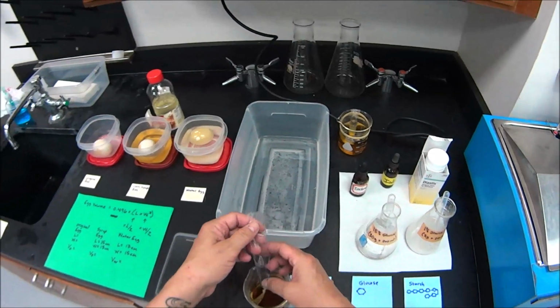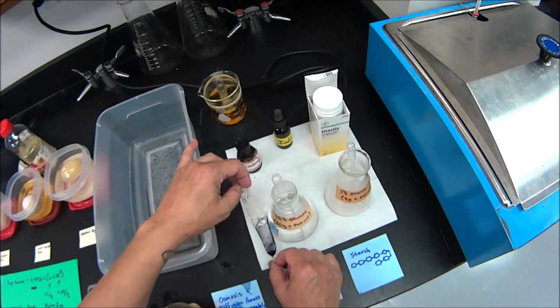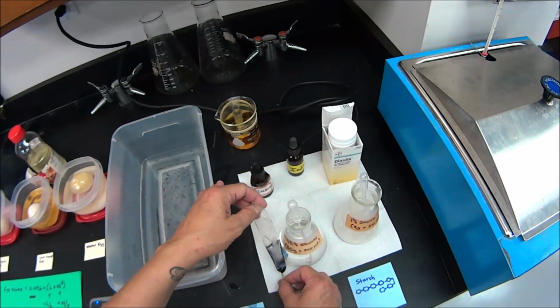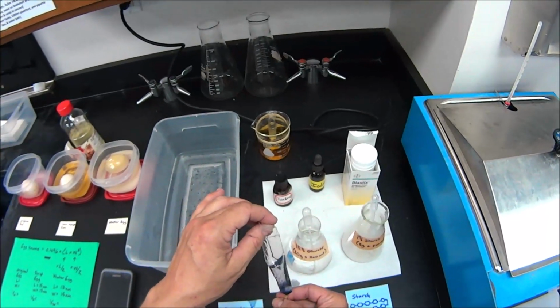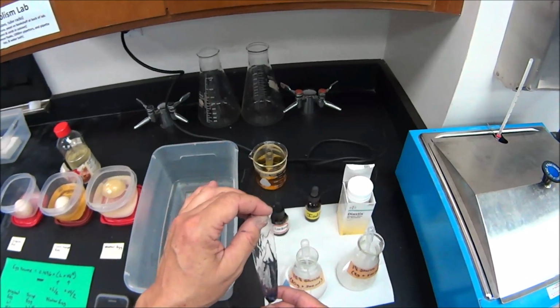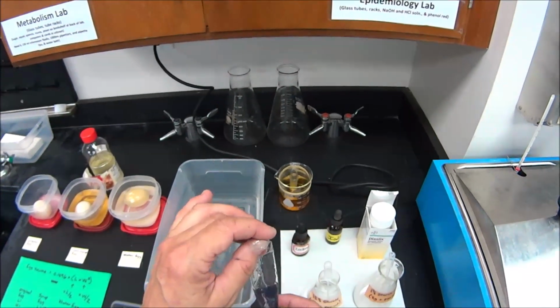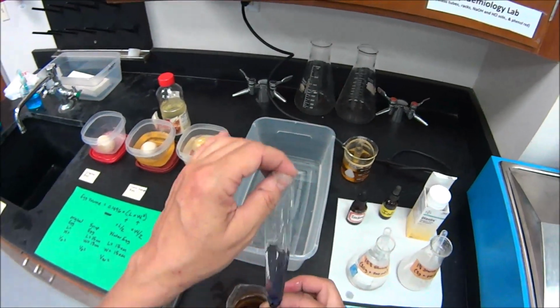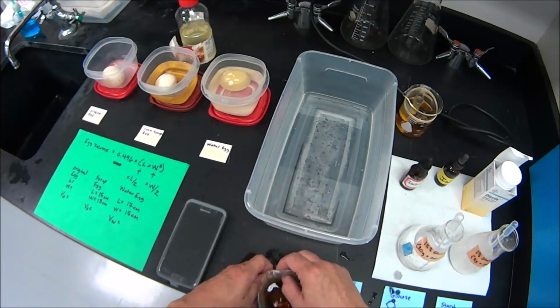Okay, here is our bag, and please notice all the bluish blackish that's in that bag. I think that iodine and water might have entered that bag. Remember, the bag is hypertonic, and the beaker water was less concentrated. There was a lot of glucose and starch in this bag. Think about how water carrying iodine would move across a membrane to dilute a hypertonic solution. There's a term for that movement of water. Okay, that's going to be in your questionnaire.